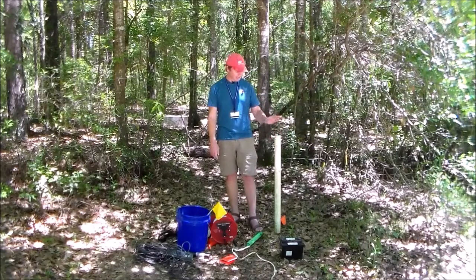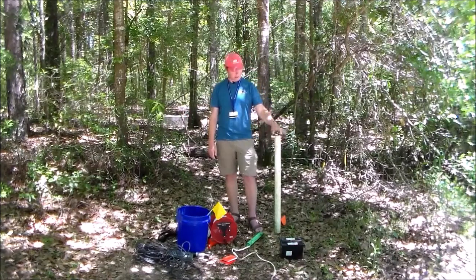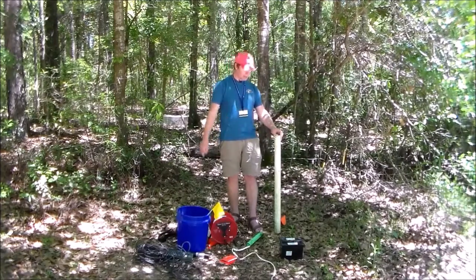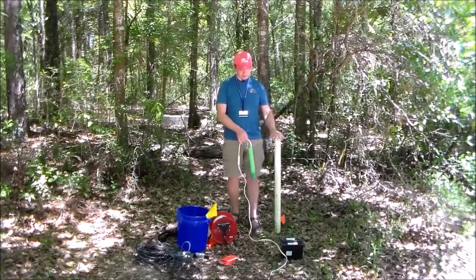So what I really have to do today is I just want to pull a sample and do some simple analyses, okay? So I'm going to install this pump right here, this pump down here into MW2, and we'll pull the groundwater up to the surface.